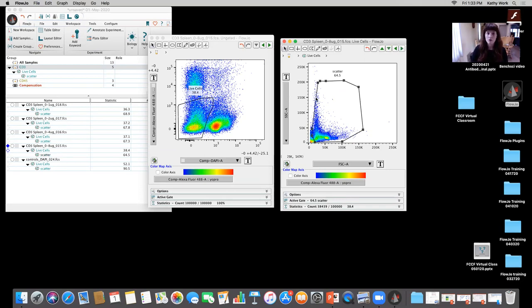So we've already learned two things. We've learned that we have to utilize the appropriate controls and make sure that we're naming them correctly so that we actually do have a good understanding of what we're looking at. And we learned that when we're looking at unstained, to get an idea of autofluorescence, there's truly no dye in there, or else it can get very confusing to define positive and negative. Okay.